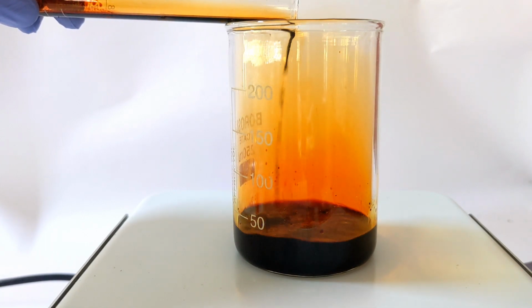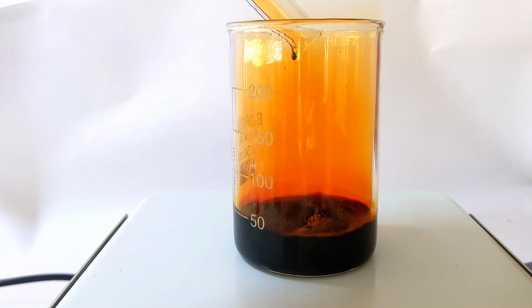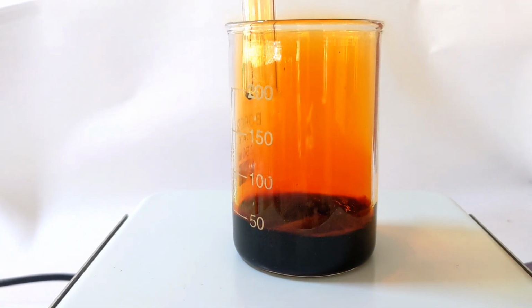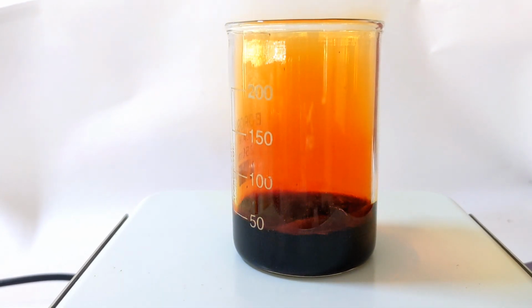Glacial acetic acid is almost pure form of acetic acid without water. If water is present, bromine would react with water rather than with aniline. Also, acetic acid is used to polarize the bromine molecule. As you know, bromine molecule itself is a non-polar molecule which would otherwise not react with aniline.